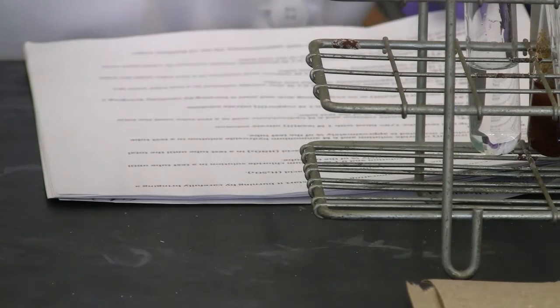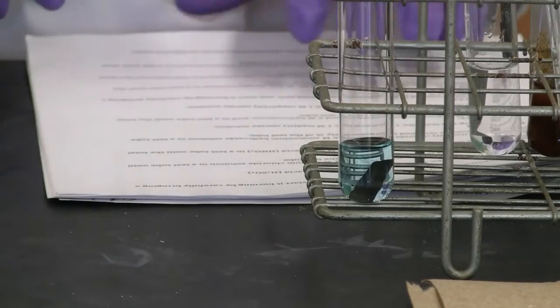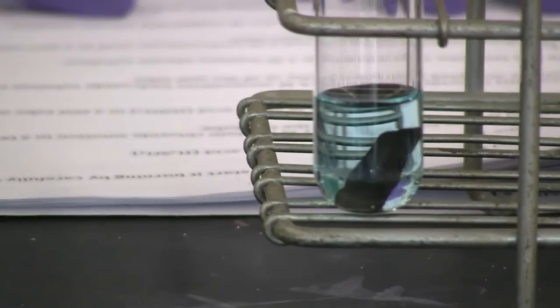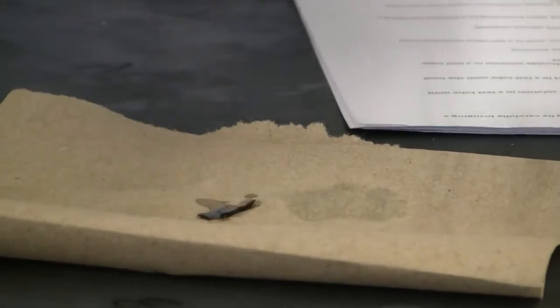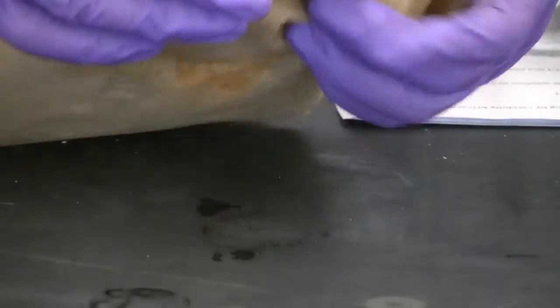Now let's go back to our reaction 13. Like I promised, we needed to check reaction 13. The lead strip and the copper 2 nitrate solution. Anything built up on the surface? Let's take out the piece and take a closer look. I'm going to decant it.